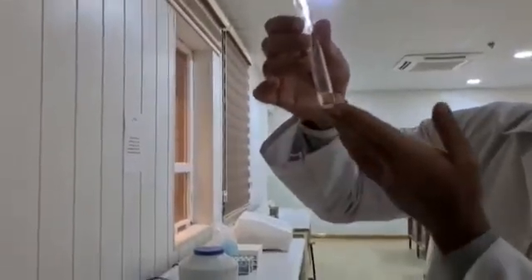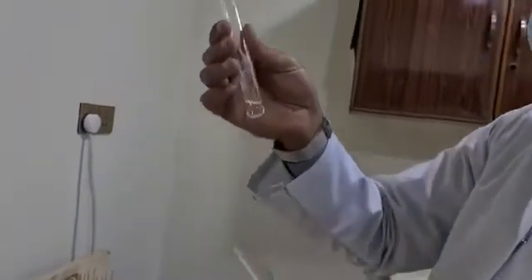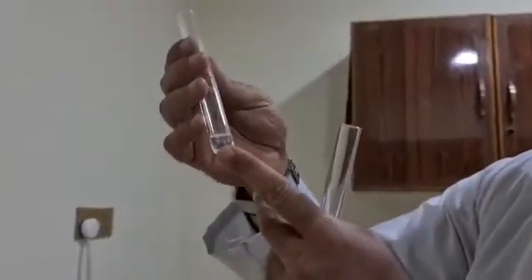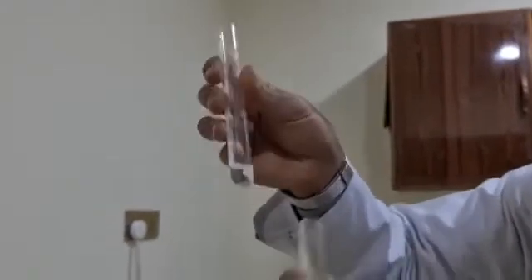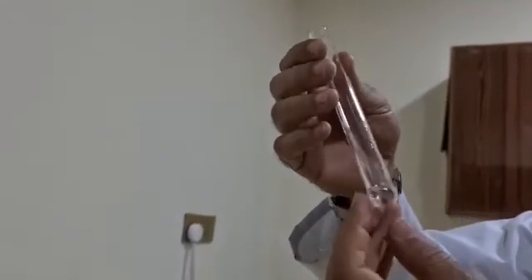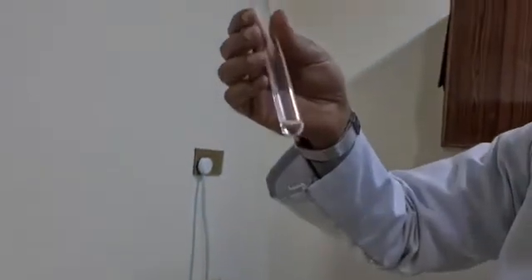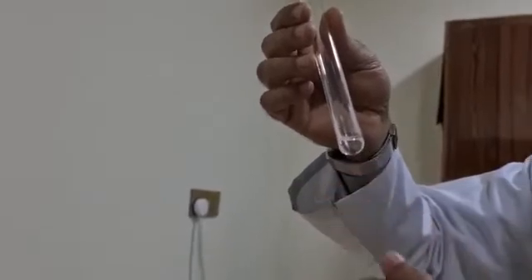We have to separate the supernatant from the precipitate. We said before that if the precipitate is not dissolved completely, we have to separate the dissolved part in another test tube. Here we have the lead chloride precipitate but dissolved in the hot. And we can confirm the presence of lead ions by the addition of 3 drops of potassium chromate.